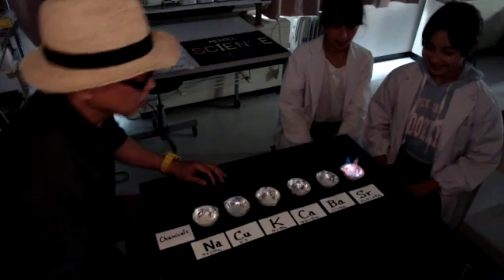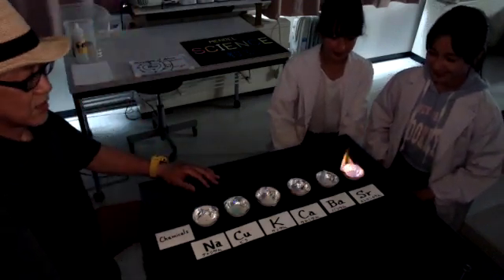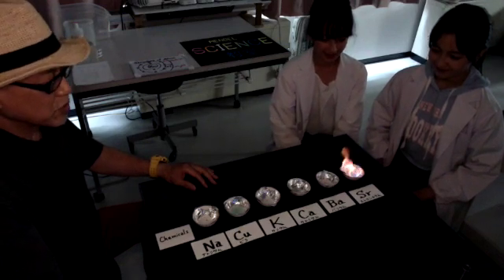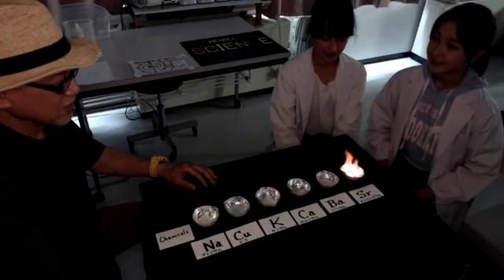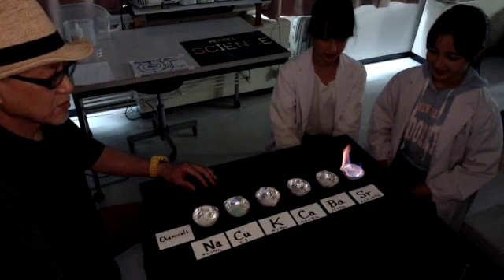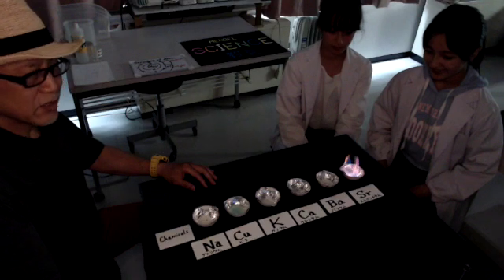Wow. Beautiful. It's pretty. The dark red color light. Dark red color light.